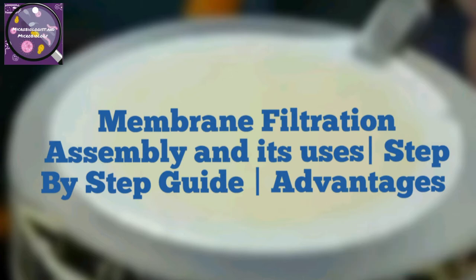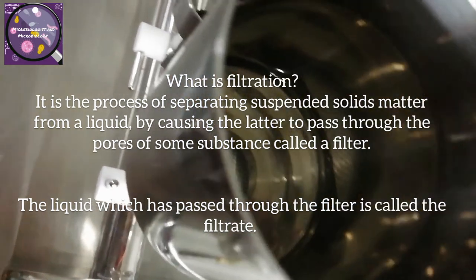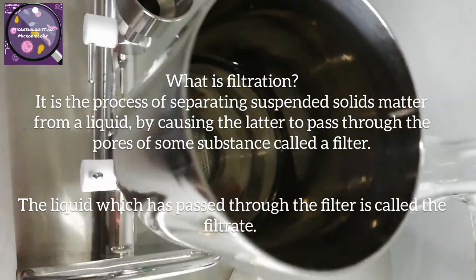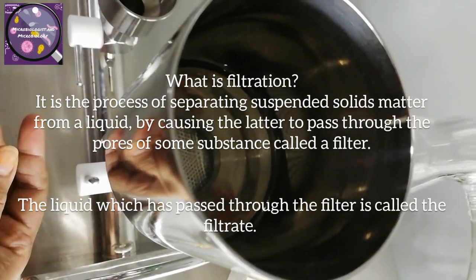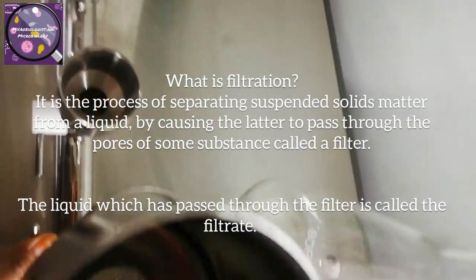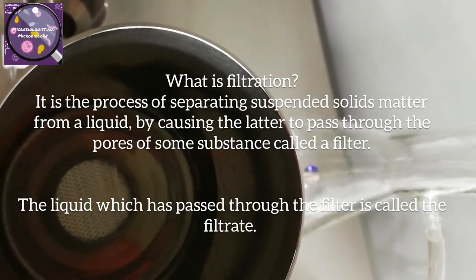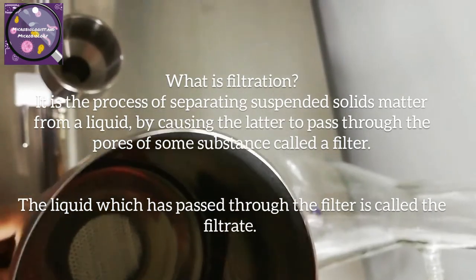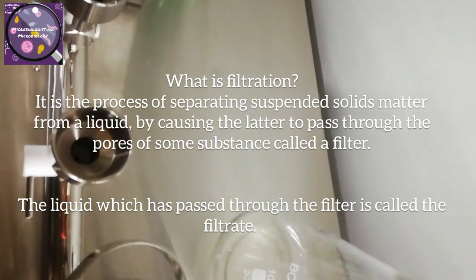Before starting this video, first we have to know what filtration is. It is a process of separating suspended solid matter from a liquid by causing the latter to pass through the pores of some substance called a filter. The liquid which has passed through the filter is called a filtrate. Here we will discuss membrane filtration assembly, its function and uses as well.